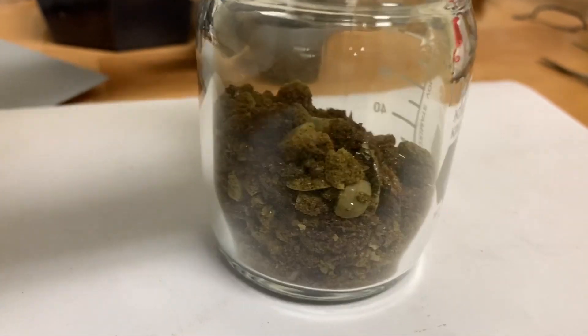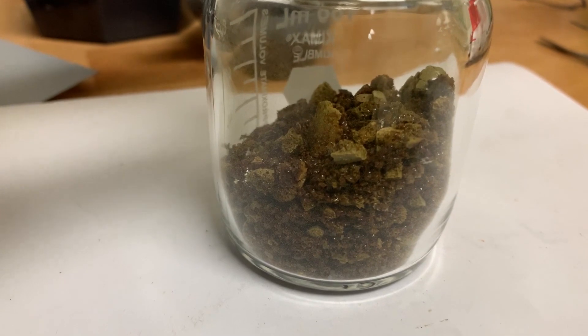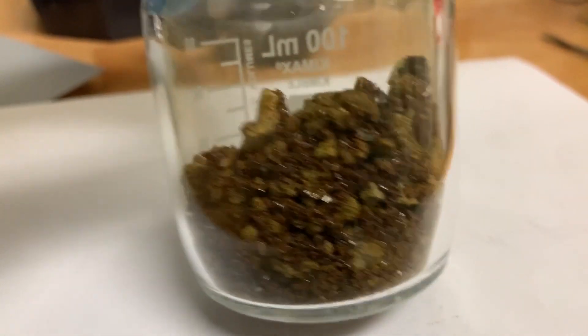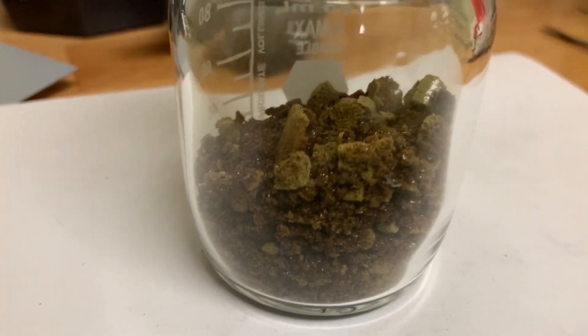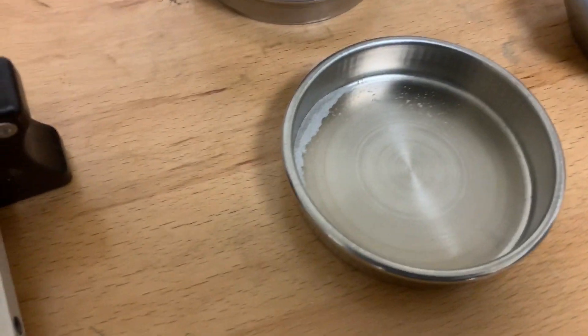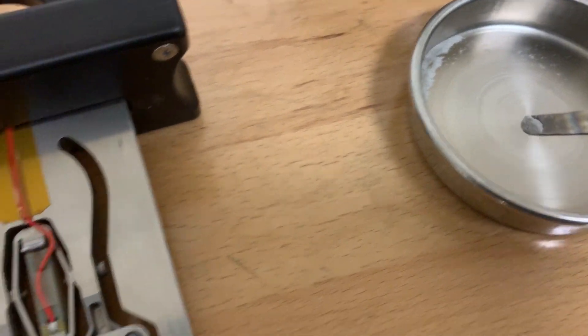Here is the residue from the distillation of the aluminum catalyst reaction. I am going to run X-ray diffraction on this to see what it is. In order to do that you have to have a powder, so I've sieved this so it will fit in the sample holder.